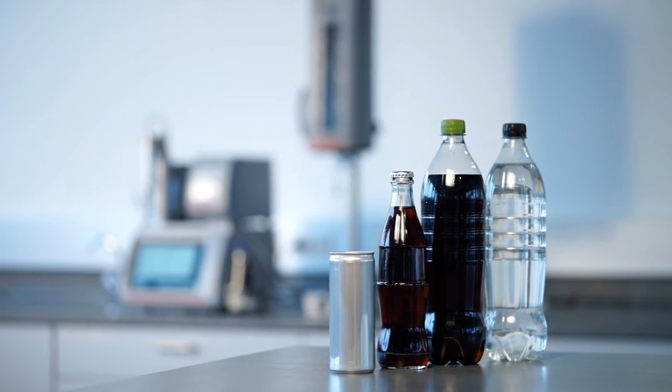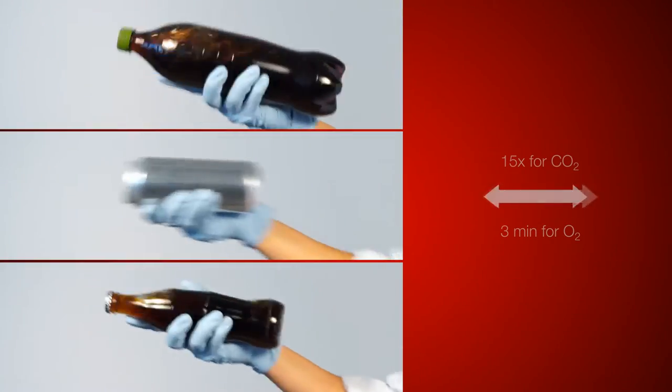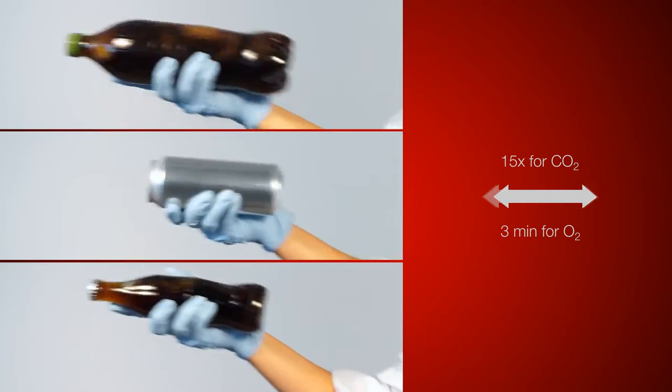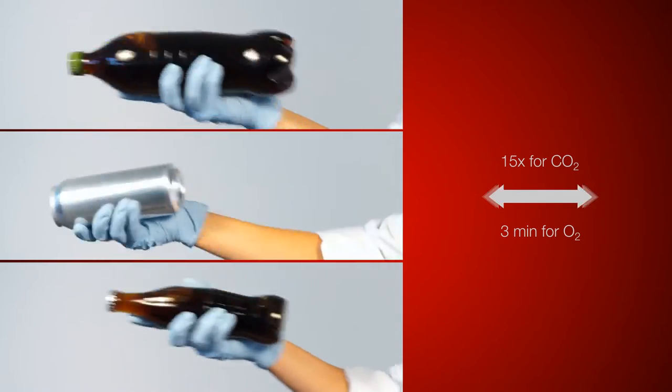Please prepare your sample for transfer. To do so, shake your sample horizontally for about 15 times to properly establish equilibrium between the CO2 and O2 content of the headspace and the liquid.